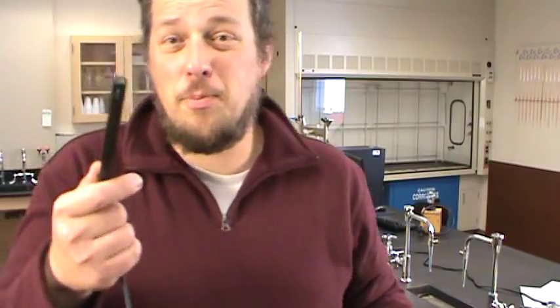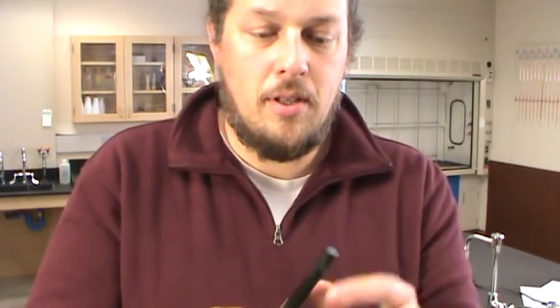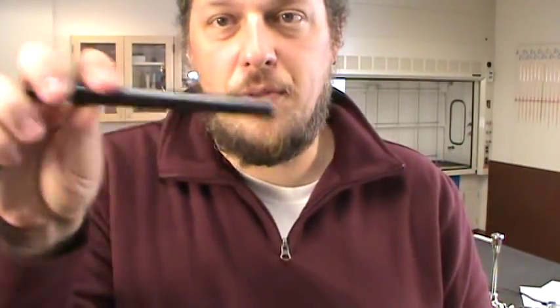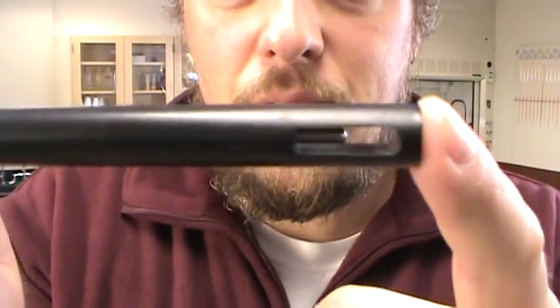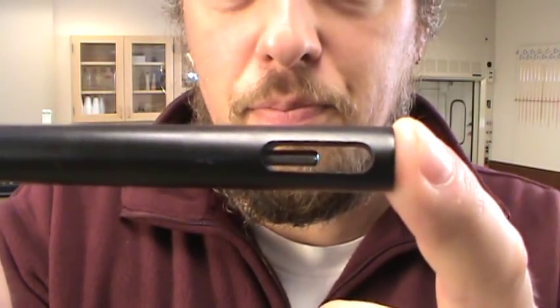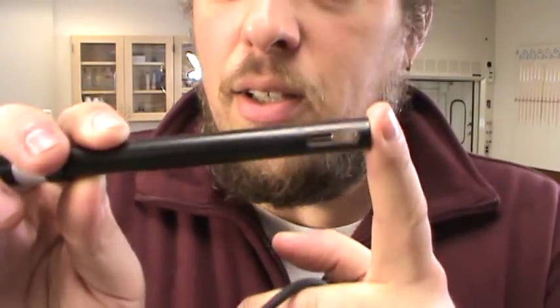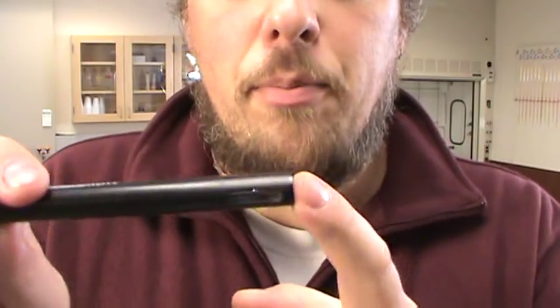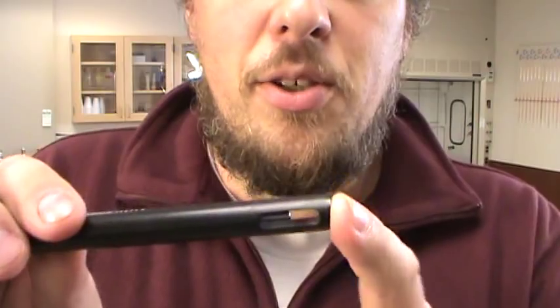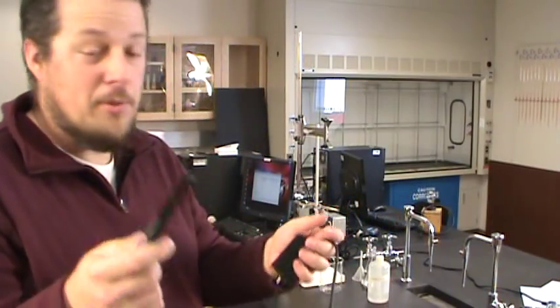The probe itself really isn't that high-tech — it's functionally a pair of wires measuring conductivity. At the bottom of the probe there's just an opening with a little metal rod sticking out into it. When using these probes, they are somewhat fragile, so be fairly gentle with them. You can dab them dry with a paper towel when moving from solution to solution, and they should behave pretty well.